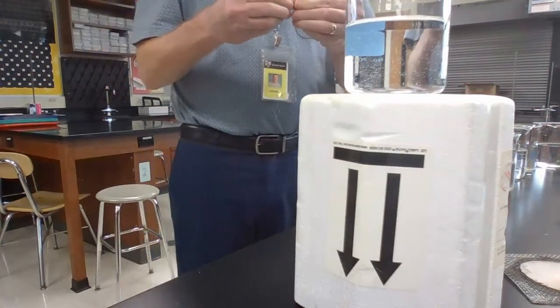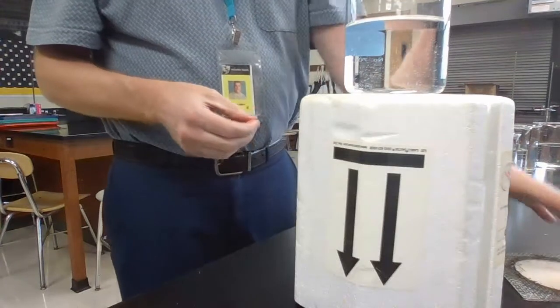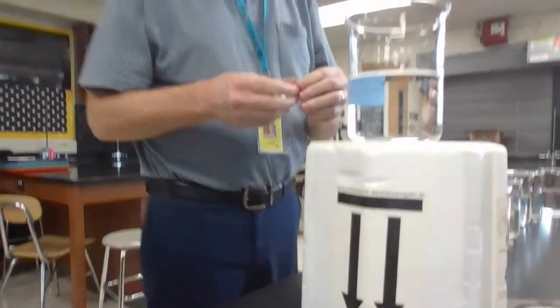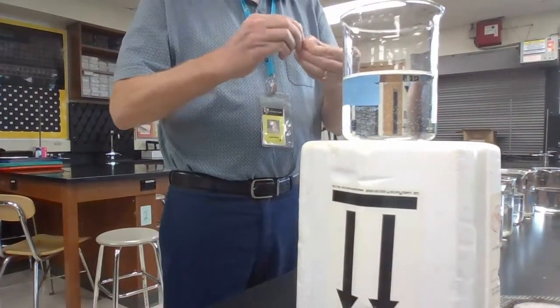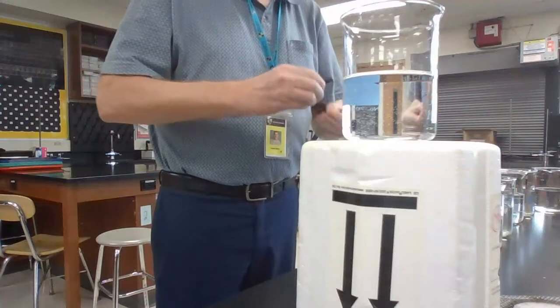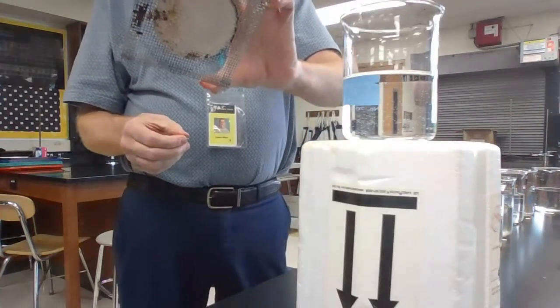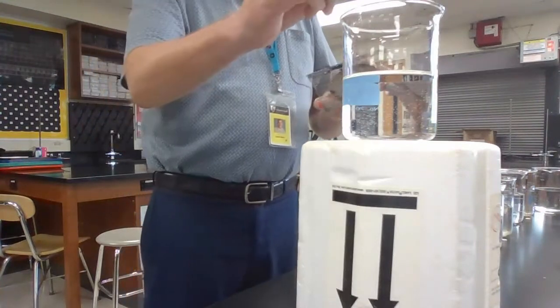But something that's special about the alkali metals, which lithium belongs to, is that they react with water. So, to show us this, are you guys ready? We're ready. Dump it in the water. All right, I'm going to put this on top of the water, and then I've got my little piece that I'm going to put in the water.